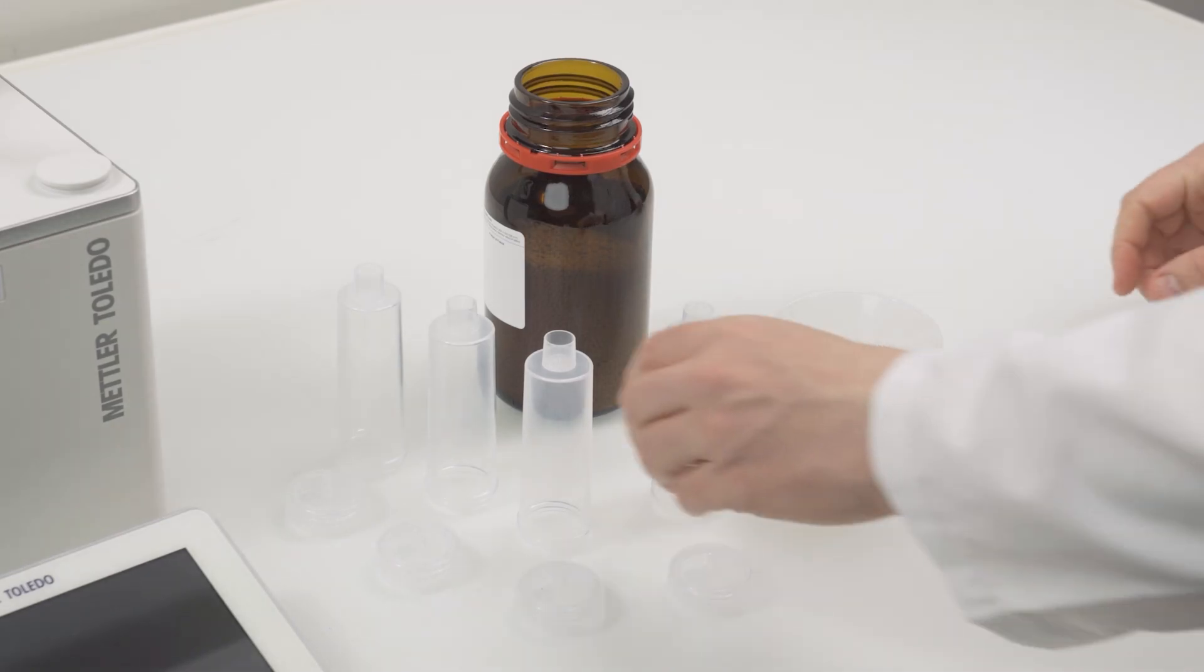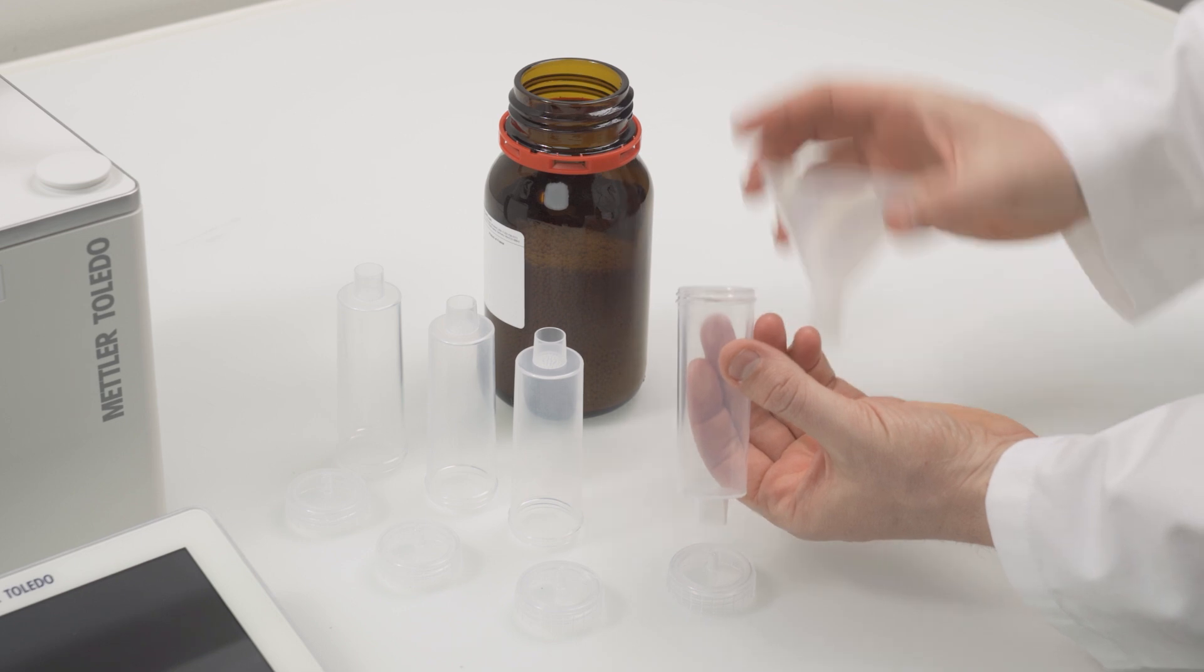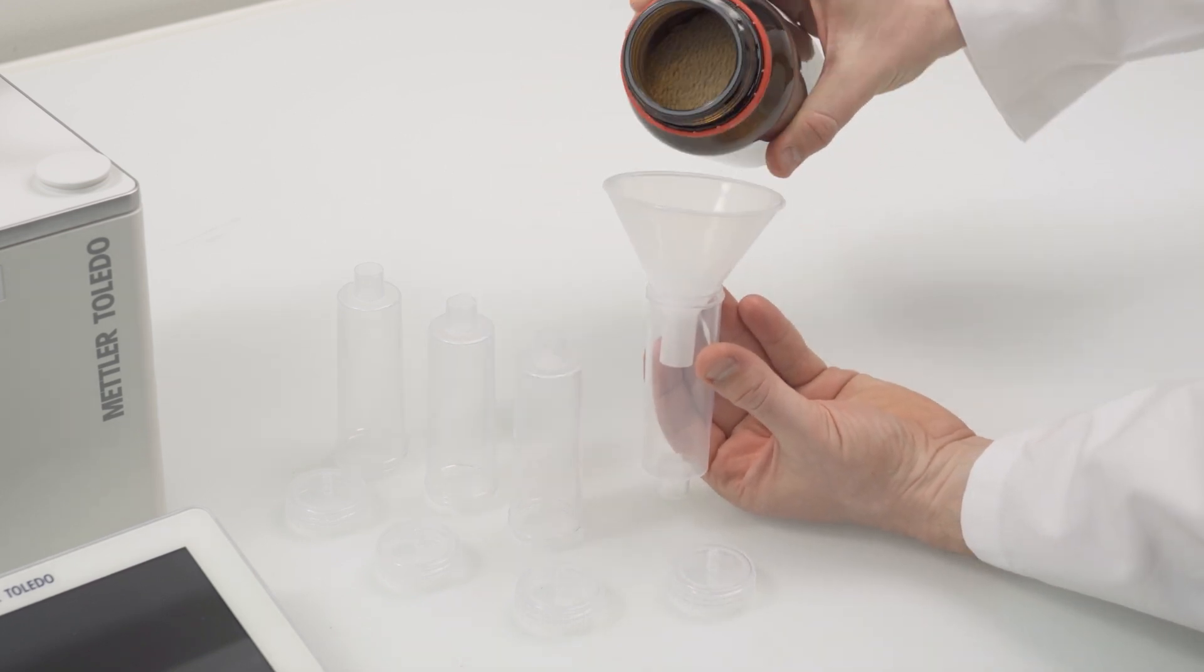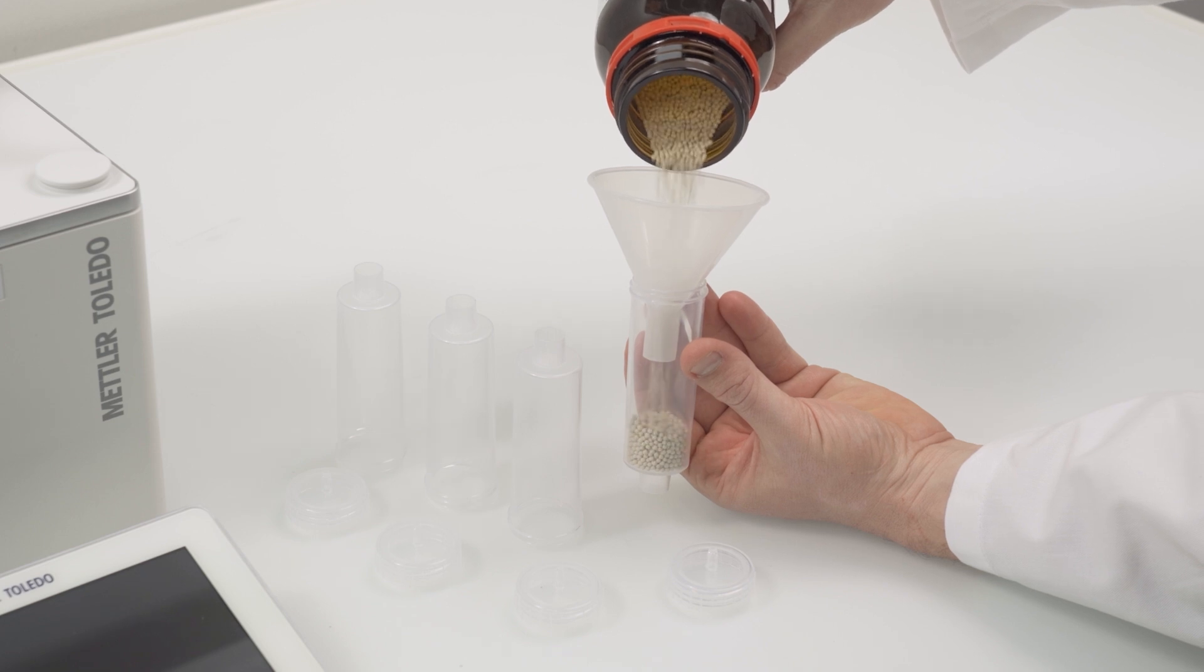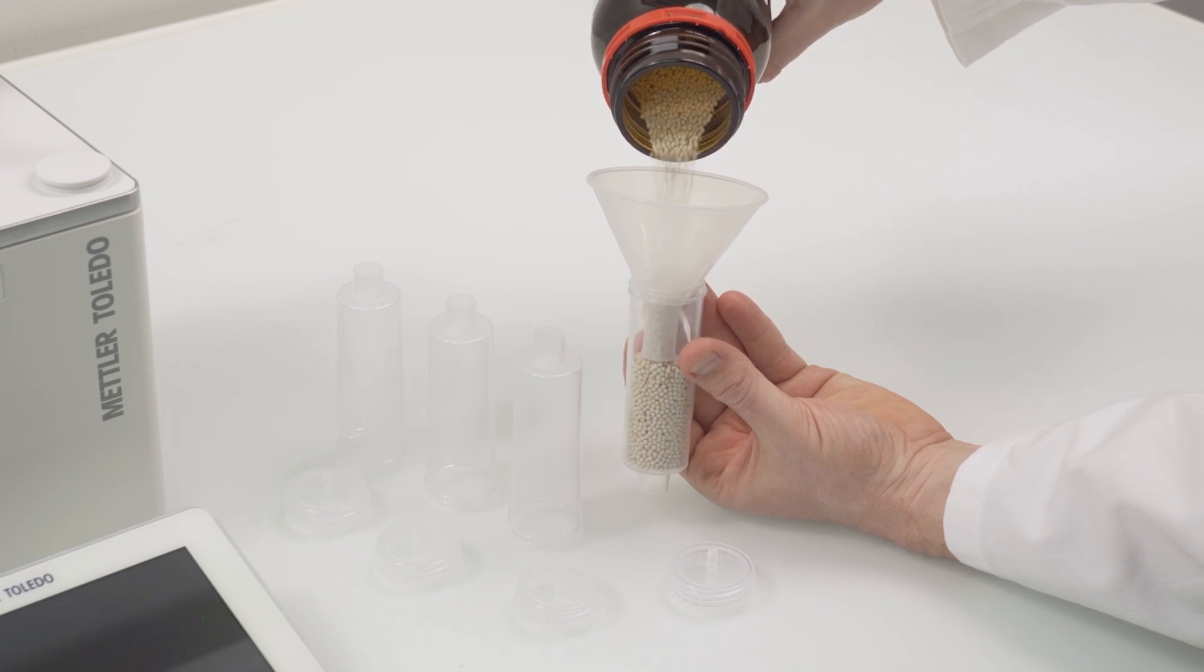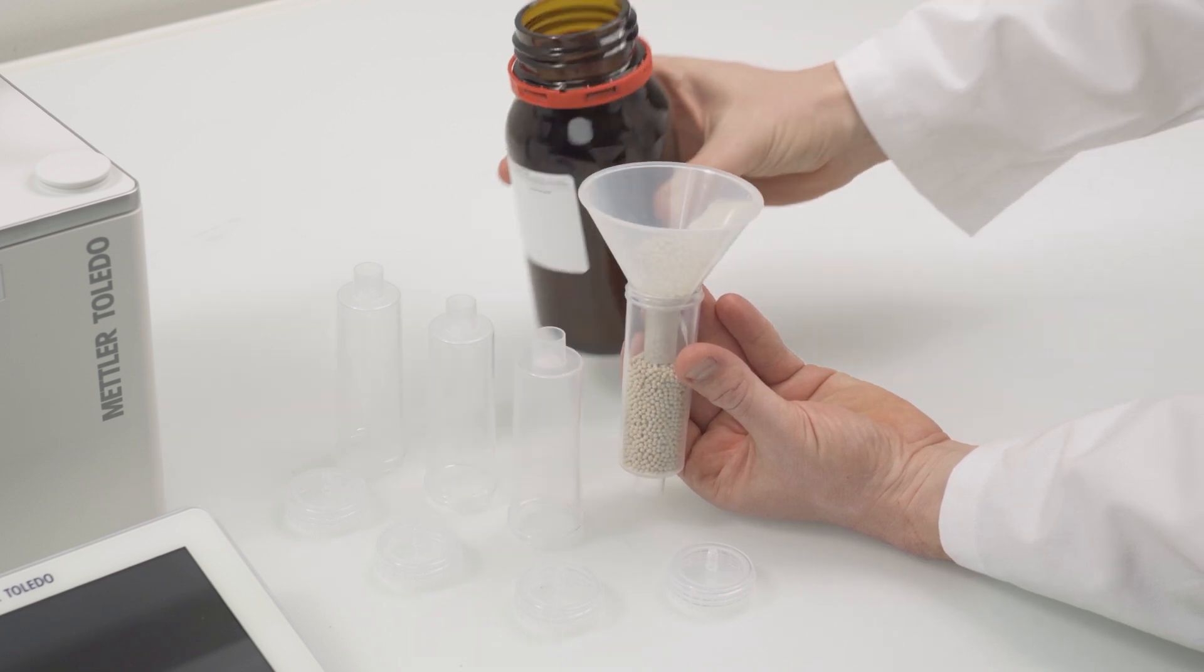Let's now prepare the drying tubes. These tubes are filled with a drying agent, the molecular sieves. The drying tubes, filled with molecular sieves, serve as a filter and protect our water-sensitive KF chemicals against humidity. Make sure that you close them tightly.